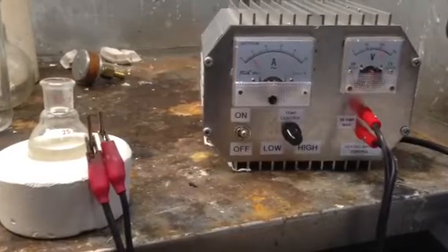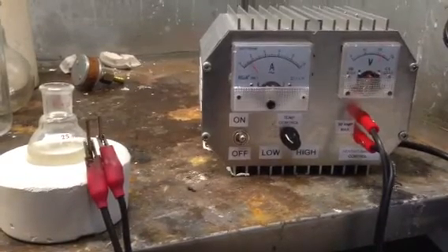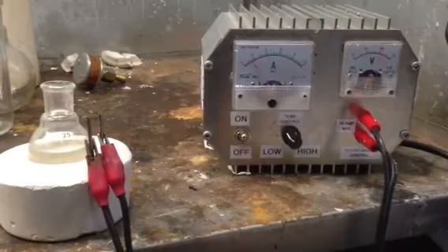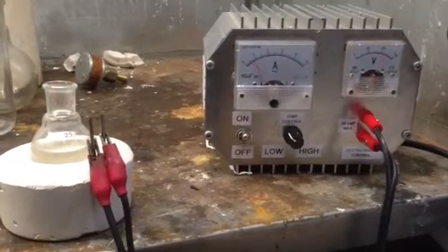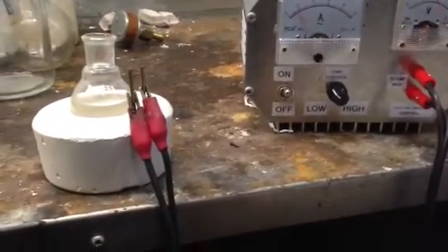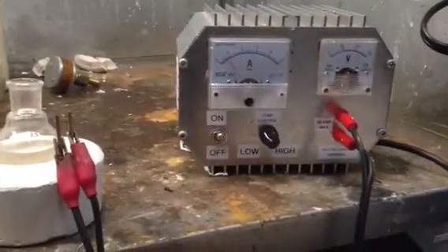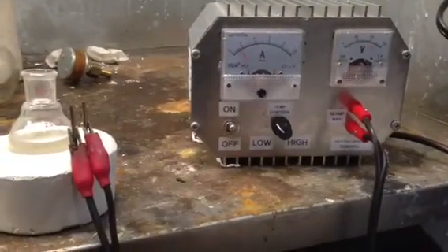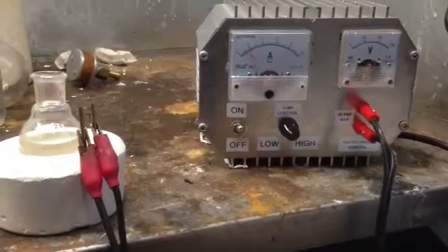You can modify it to work on an inductive load such as a motor but to keep it simple for you guys that want to make your own heating mantles and need to build your own power supply or temperature controller or whatever you want to call it.